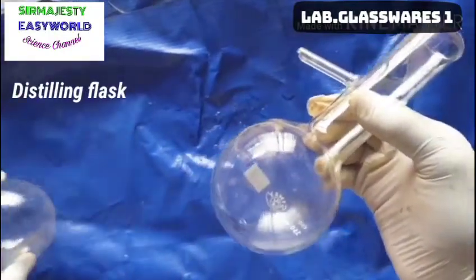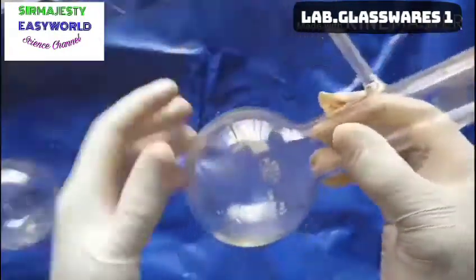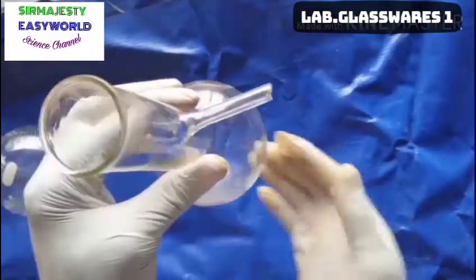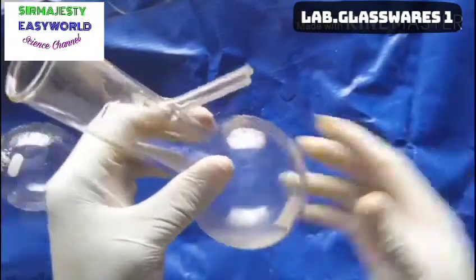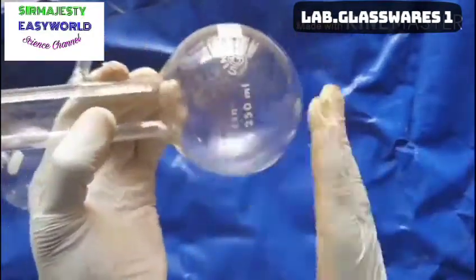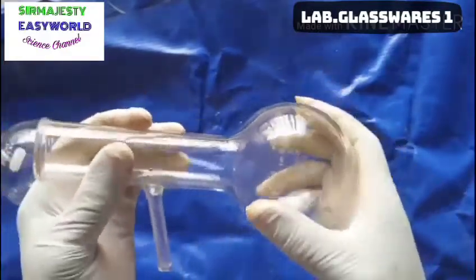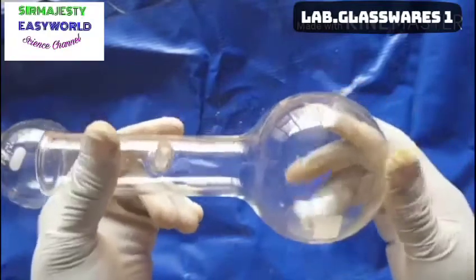That is what we call the distillation flask. The difference is that this one has an arm where you can connect your condenser. The condenser is connected here, you stopper here, then heat here — the distillate flows through the condenser and you collect it. It is still a round-bottom flask, but due to this arm it is called a distillation flask, used mainly for distillation.